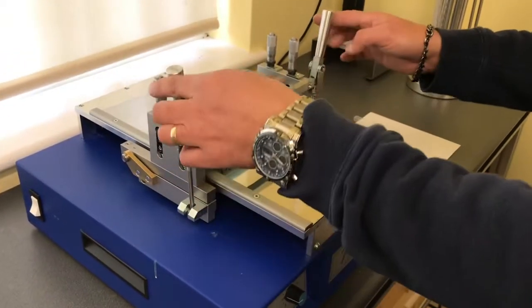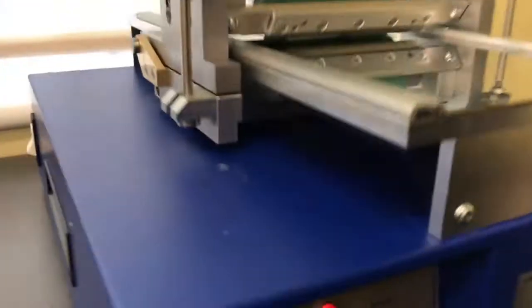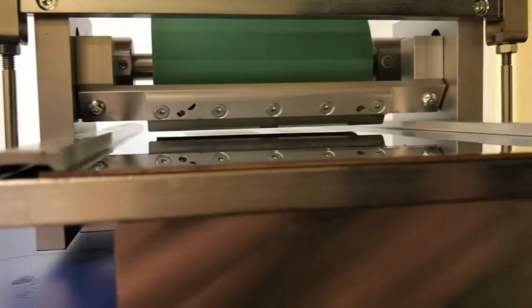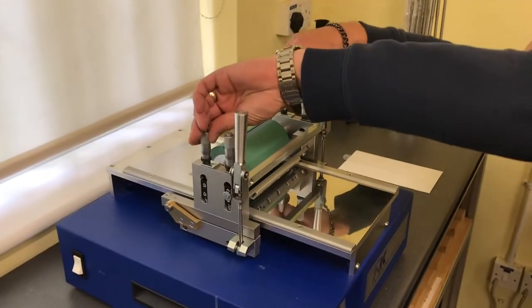Now time to adjust the rollers. Adjust the rubber roller first at the back. Before you adjust it, there should be a gap, so look for a gap.